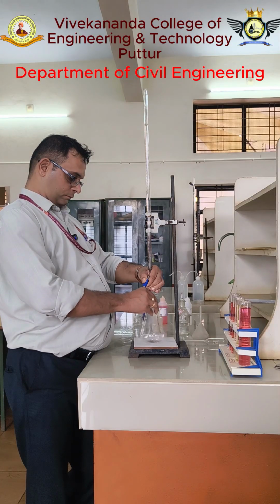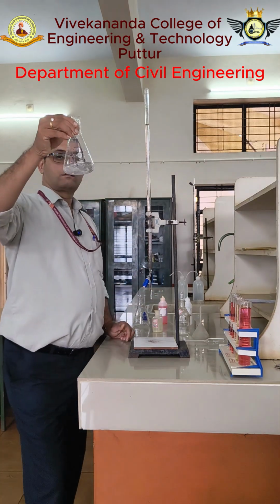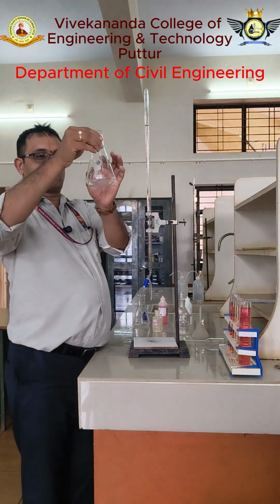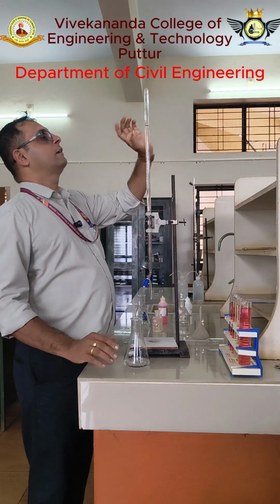Now the color of this is colorless. That means pink to colorless is already achieved. So note down the reading.